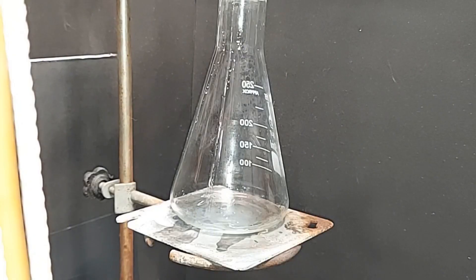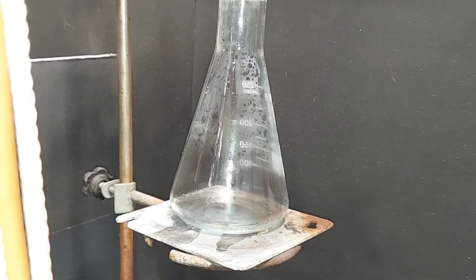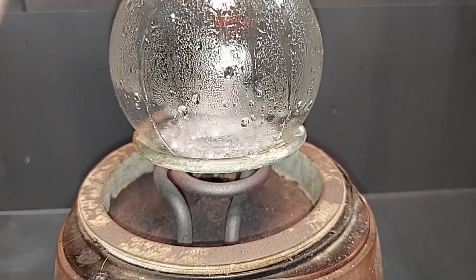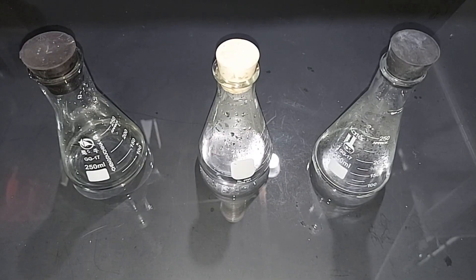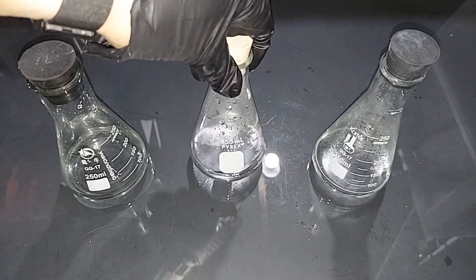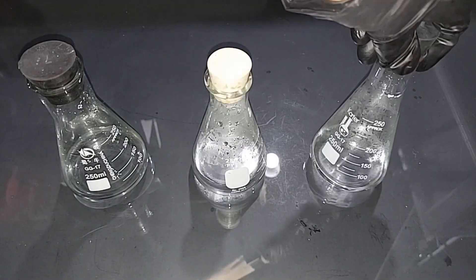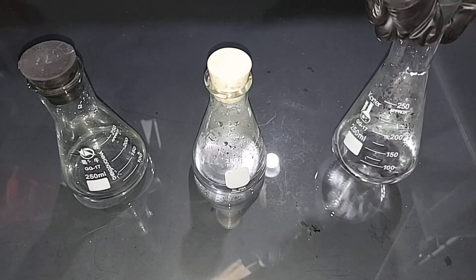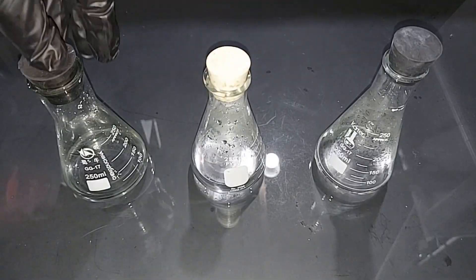The temperature has jumped up to 105 degrees Celsius, so I swapped out the flask one more time — this will be the purest form of formic acid in this particular flask. We are boiling away just the last little bit of solution. Here are the three flasks we've collected from the fractional distillation: the one on the left is mostly water; the second, collected between 101 and 104 degrees Celsius, is probably about a 40 to 50 percent solution of formic acid; and the last one, collected at 105 degrees Celsius and above, is the closest to the 77 percent azeotropic mixture of formic acid. That last flask is what I'll definitely keep for future experiments.